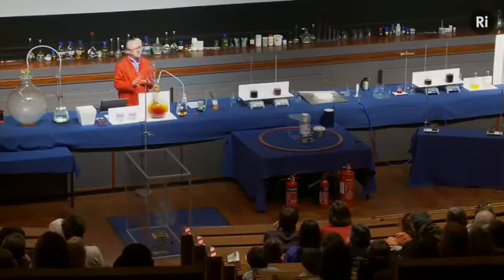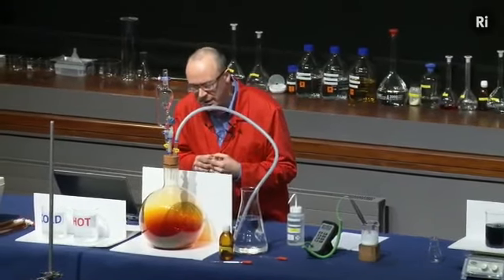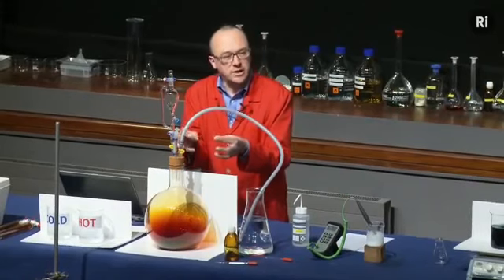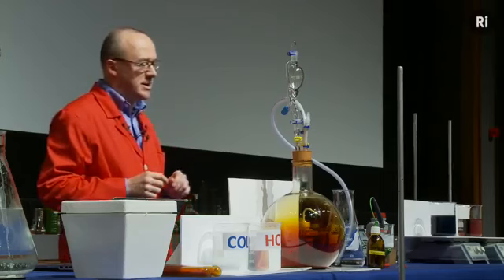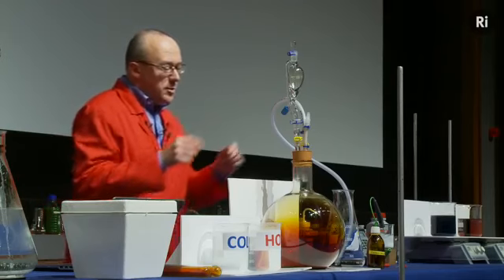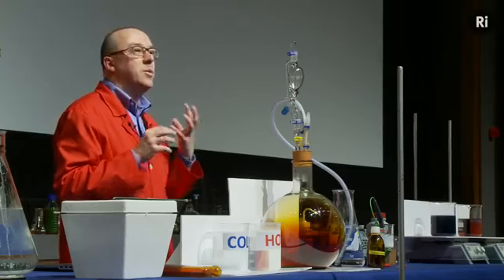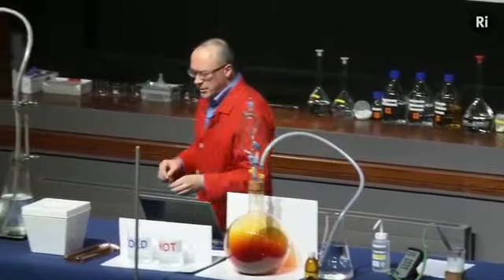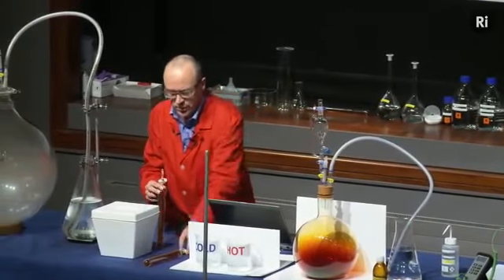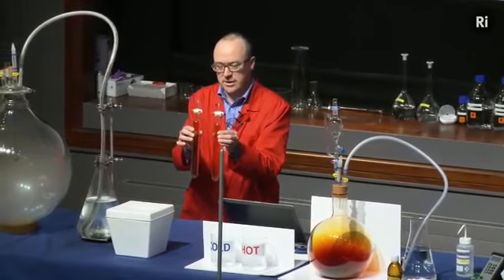So that's the reaction of nitric acid with copper, and it's produced these dark brown fumes, which you can see, and those fumes are called nitrogen dioxide, and they are actually pretty unpleasant, which is why we're doing this in a sealed apparatus. But nitrogen dioxide is a material that can help us understand this question about whether a chemical reaction can go backwards. So in these tubes, we have equal amounts of nitrogen dioxide.